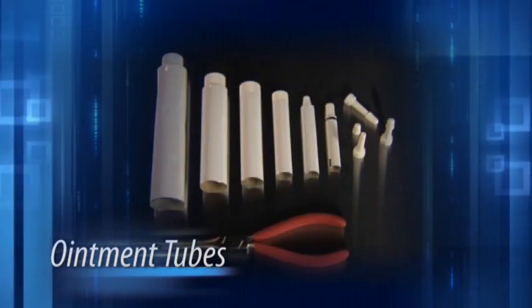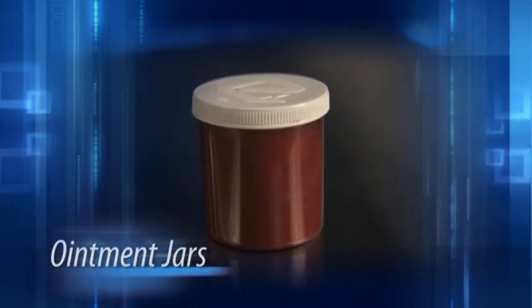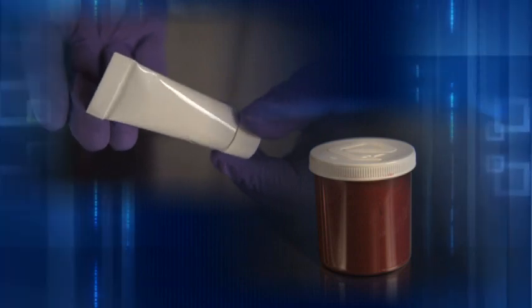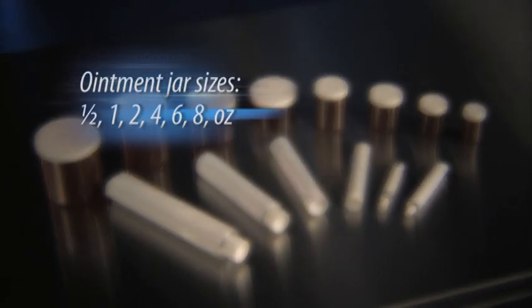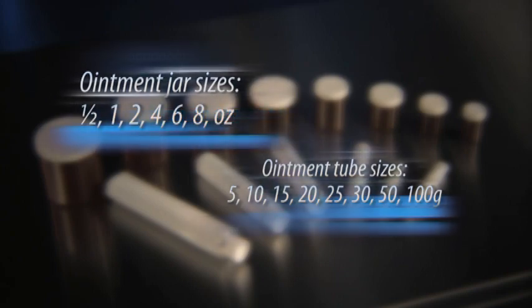Just as the vials are designed to store solid dosage forms, ointment jars and tubes are made for storing semi-solid pharmaceutical preparations, such as ointments, gels, creams, pastes, and lotions. These jars and tubes are designed to protect the preparation from light and contamination. Ointment jars and tubes come in a variety of sizes that make it easy to find just the right package.